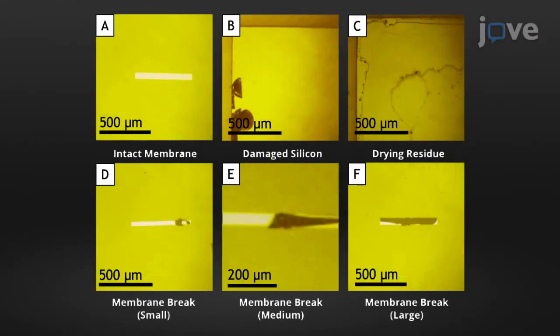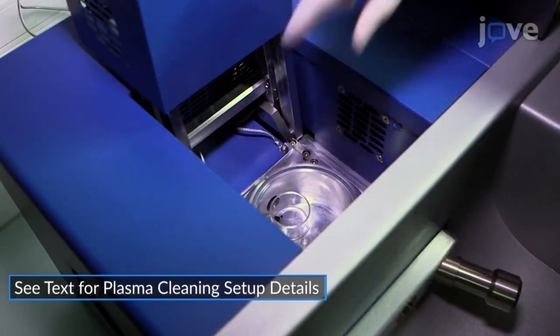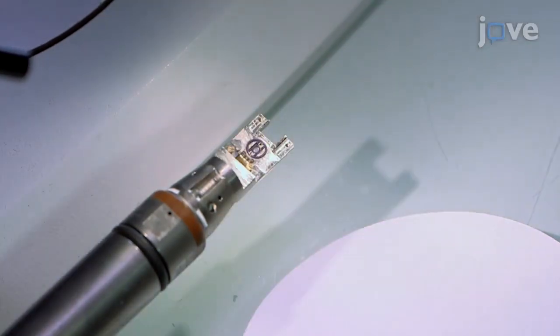And use a binocular magnifier or an optical microscope to verify the integrity of the silicon nitride window. If the chips are intact, plasma clean the E-chips with a mixture of argon and oxygen gas for 2 minutes. And load the gasket O-rings into the liquid cell holder.